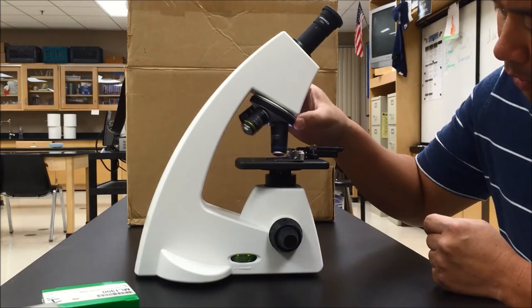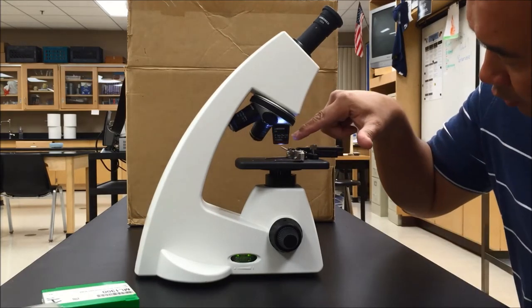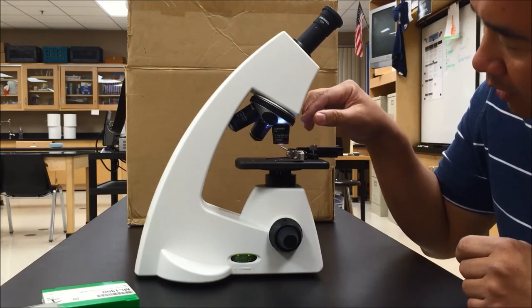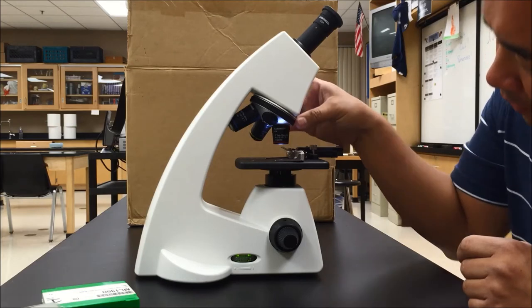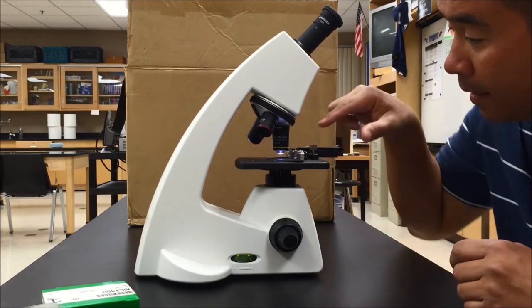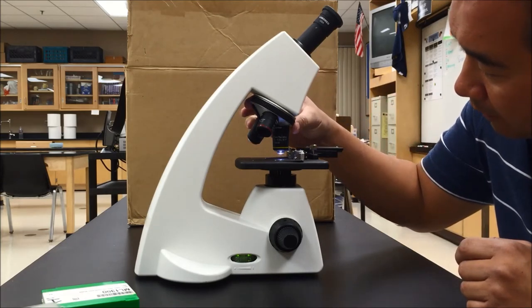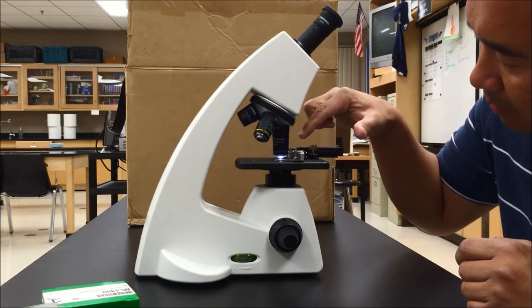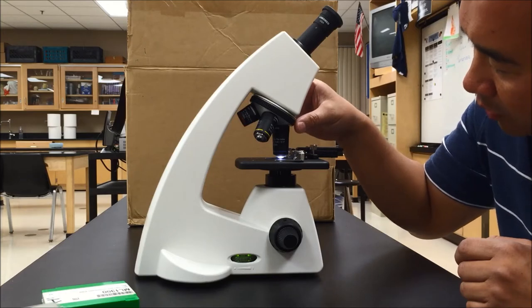There are three types of objective lenses. The first objective lens is the shorter one and it's color-coded red — this is low power with a magnification of four times. The next is medium power, color-coded yellow, with a magnification of 10 times. The last is high power, color-coded blue, with a magnification of 40 times.